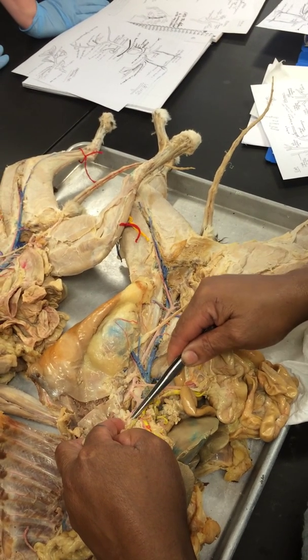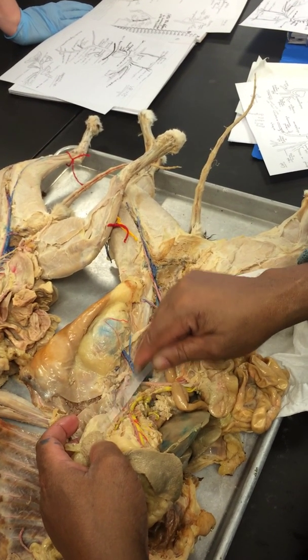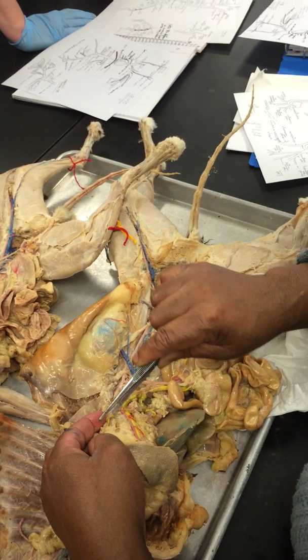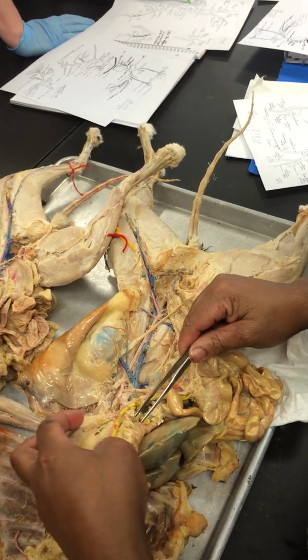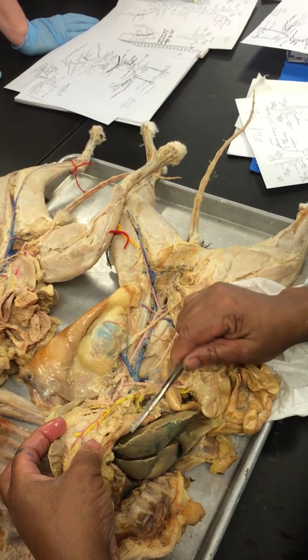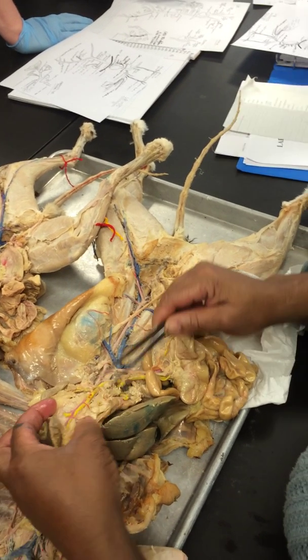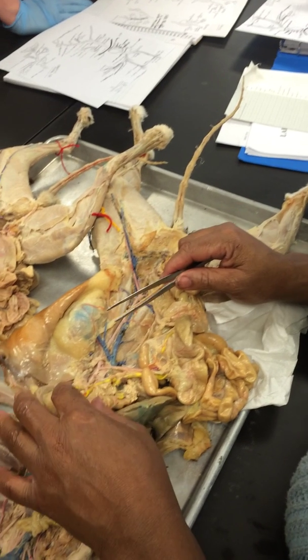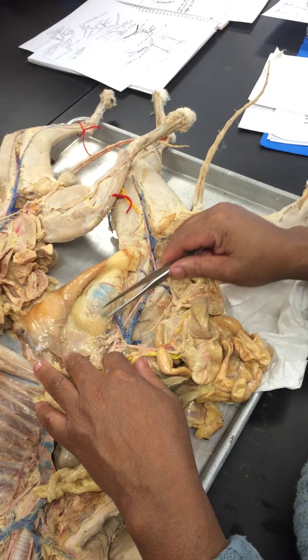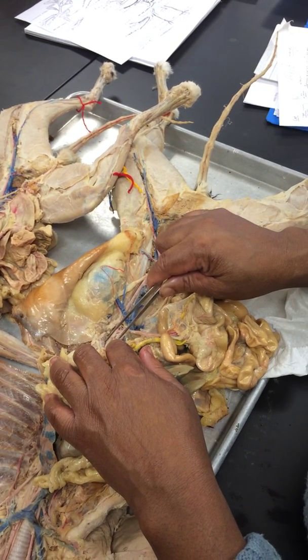And it branches again. There's actually a couple of branches off. That's going to the stomach over here. So this is the gastric artery, that red one there. And then the pancreatic arteries are these little ones that deliver to the pancreas. Now for tracing purposes, it's a good idea to know that the celiac delivers to these organs, but for pinning purposes, you just need to know the celiac.